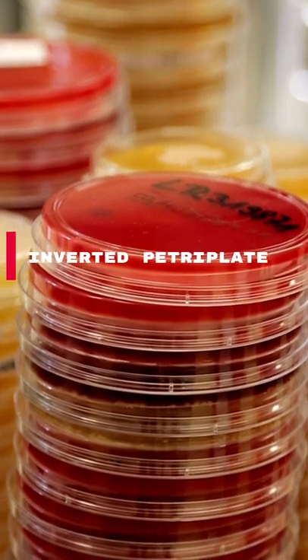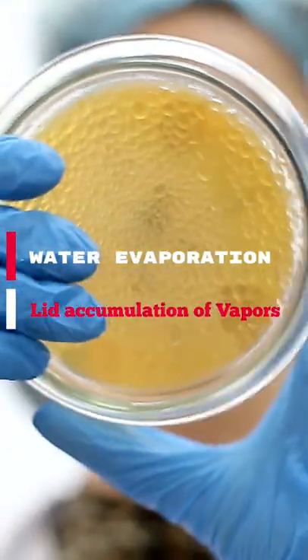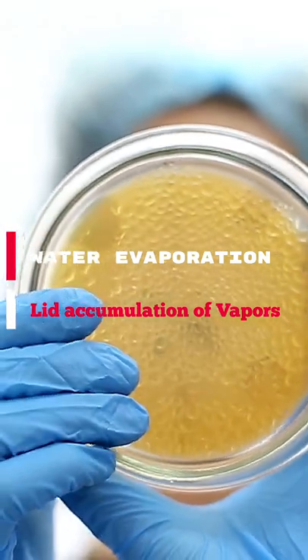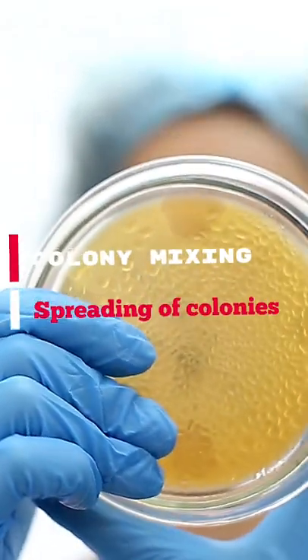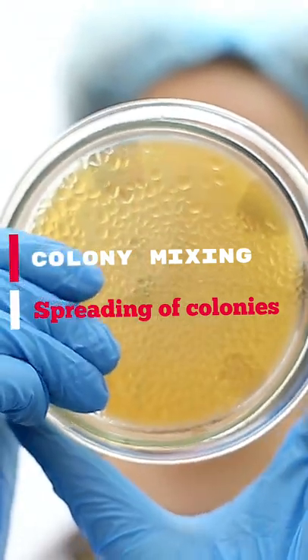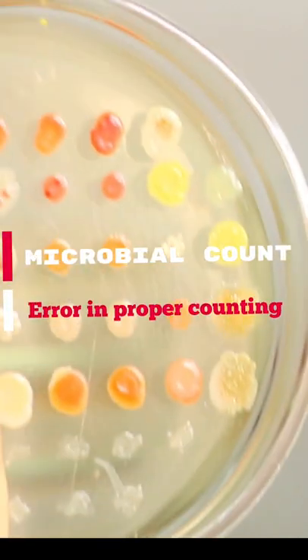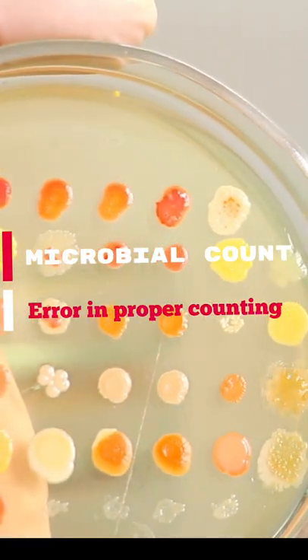When the plates are incubated in the normal position, water evaporation from the media occurs. These vapors condense on the lid of the petri dishes and drops fall on the colonies developed on the media surface. This causes colonies to mix up with each other and spread throughout the plate surface, creating problems in counting and proper determination of microbial count.